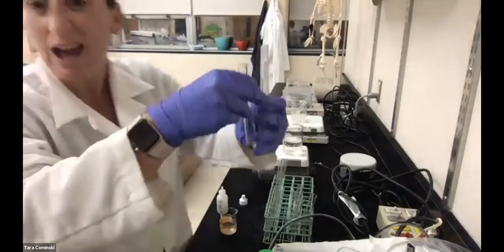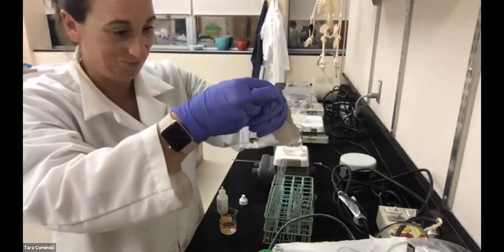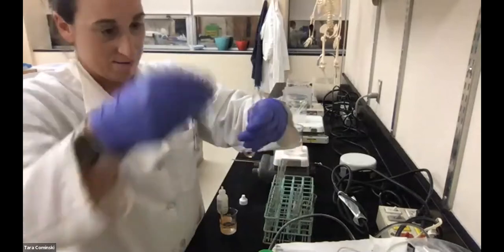That's why it's helpful to have two people doing this, a lab partner, right? I don't have a lab partner. Anyway.